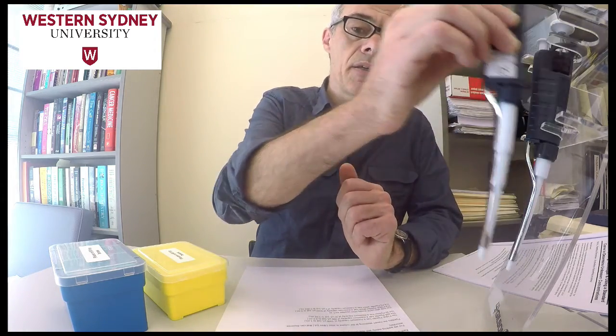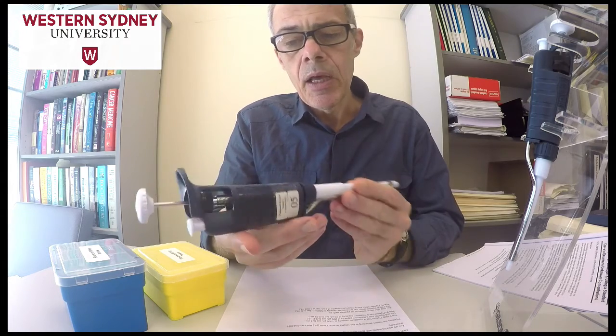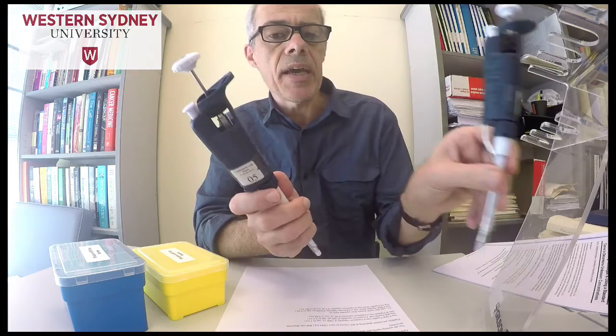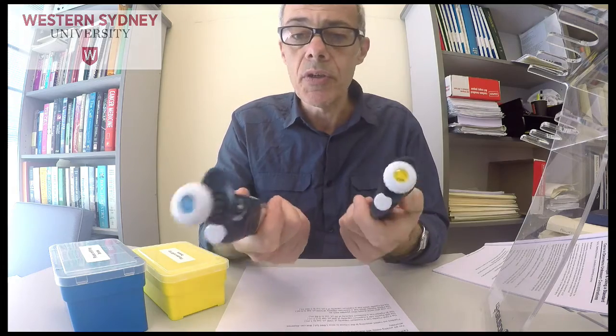So this is a brief guide to using the micropipettes, and these here are some examples of micropipettes. The first decision you need to make is which pipette is the correct one for the volume which you want to dispense.